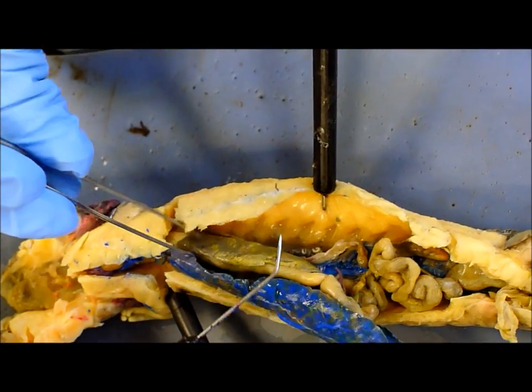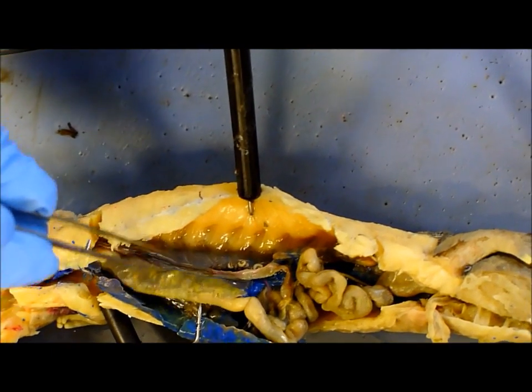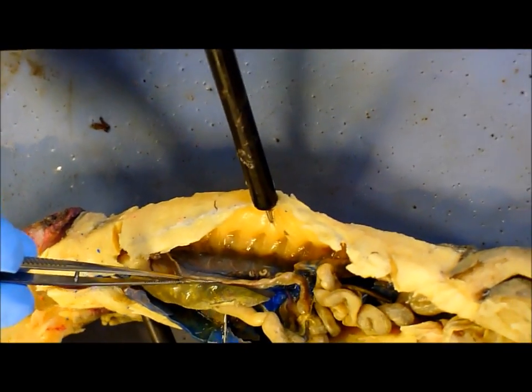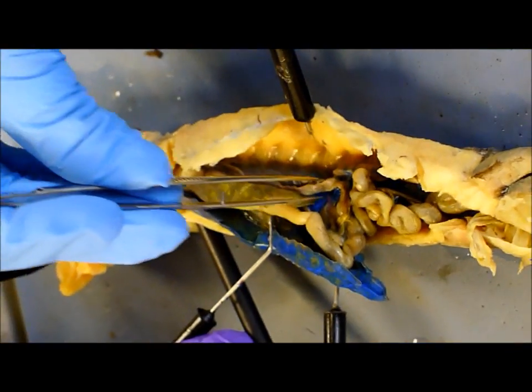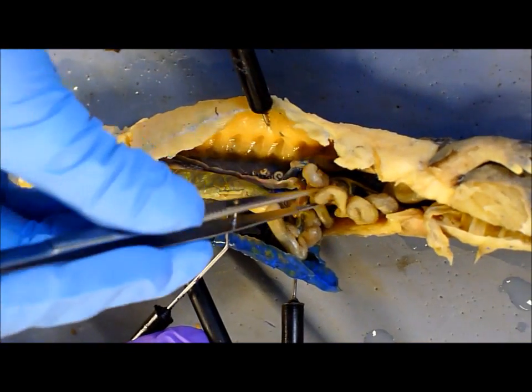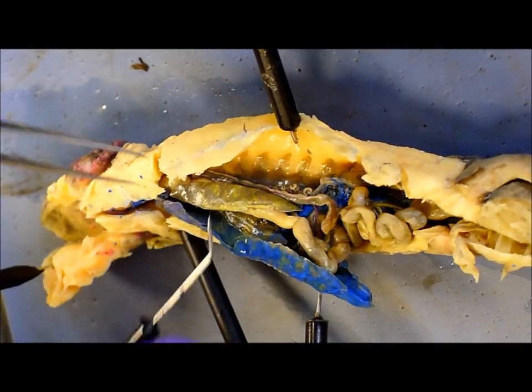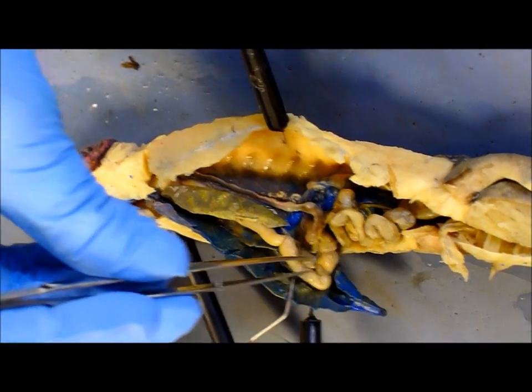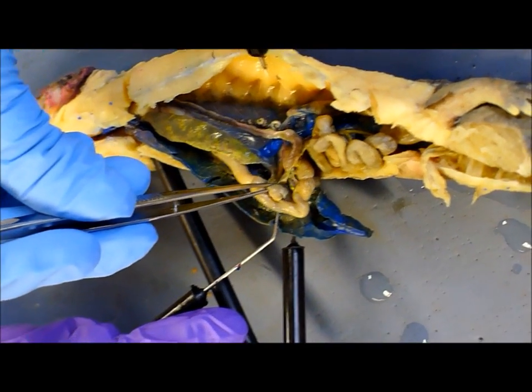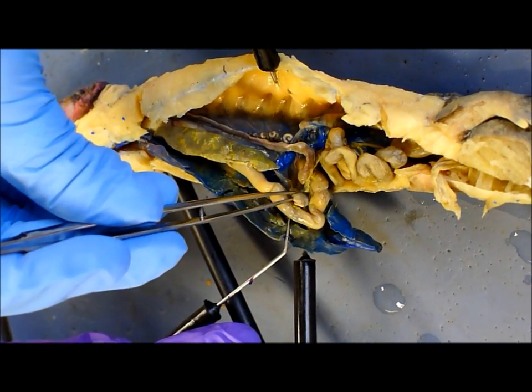Lungs — these little weird deflated balloon-type things on the side, pretty long. Small intestine. Pancreas is this little globby thing right here at the end of the stomach.